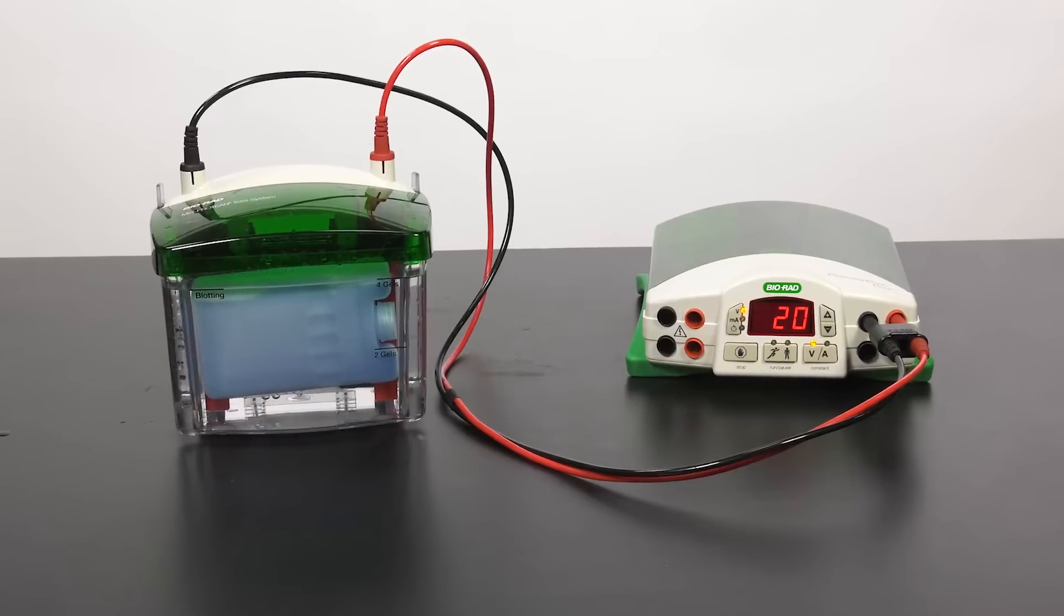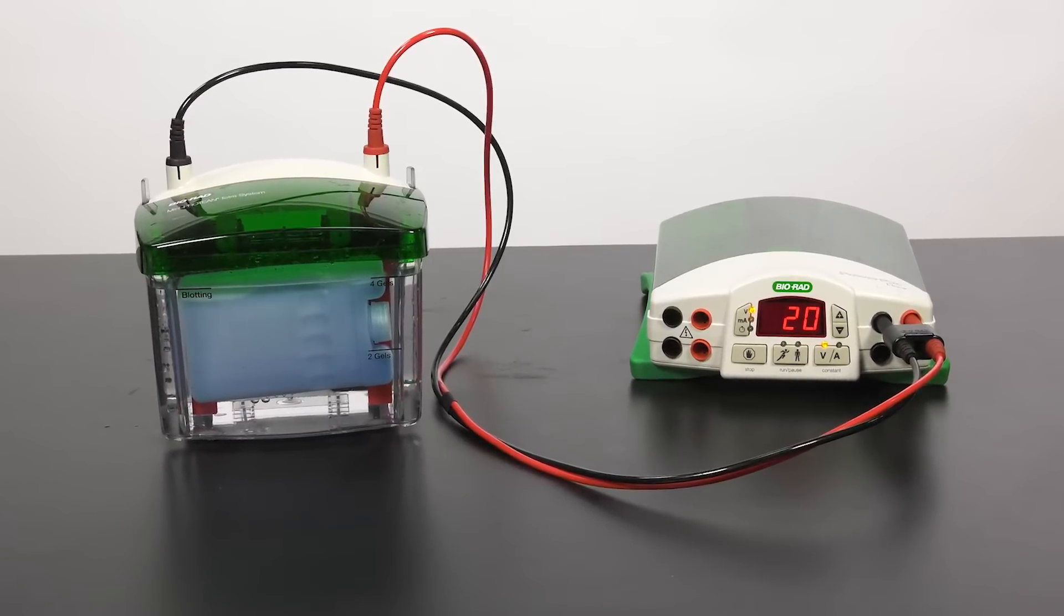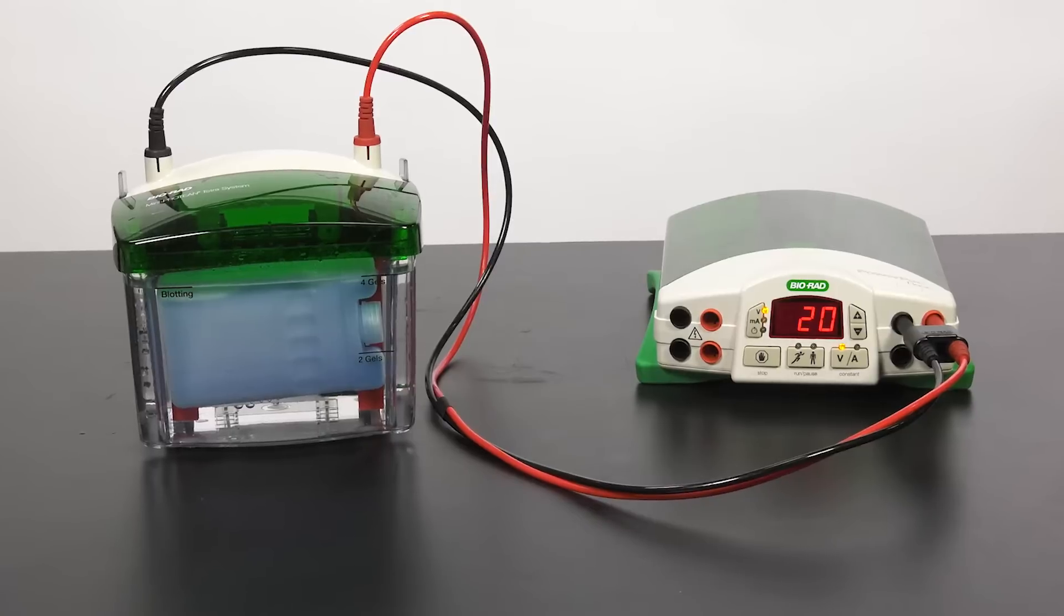In this video, we will show you how to set up a polyacrylamide gel for wet tank transfer in a mini-trans blot cell.